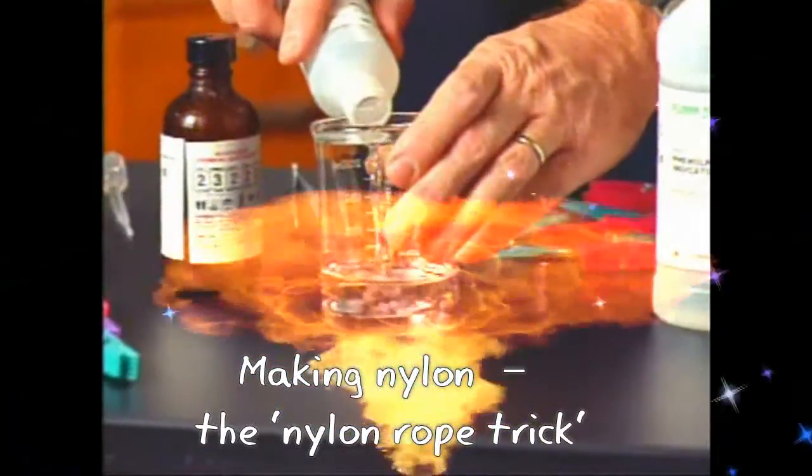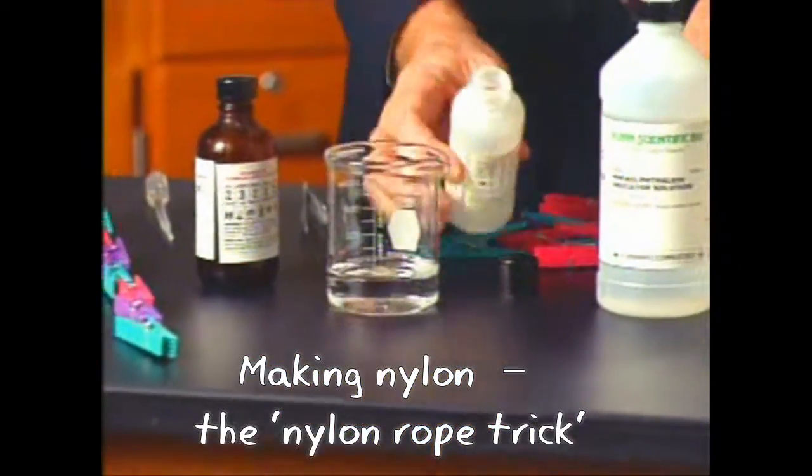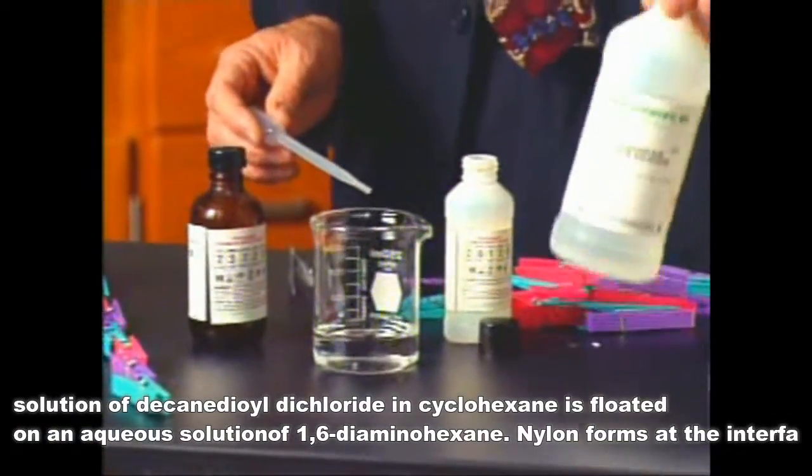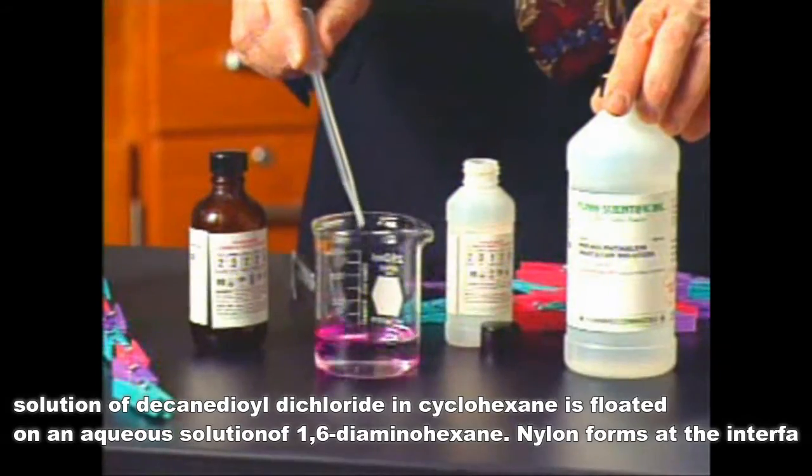What you're interested in seeing is the real chemistry and one of the most useful polymers today that we find is nylon.